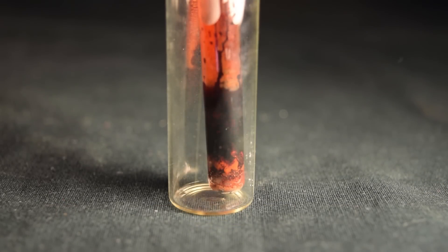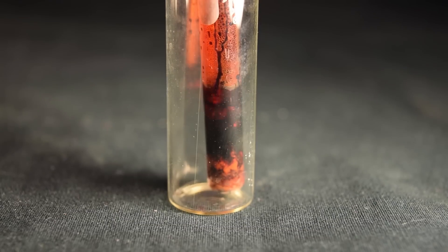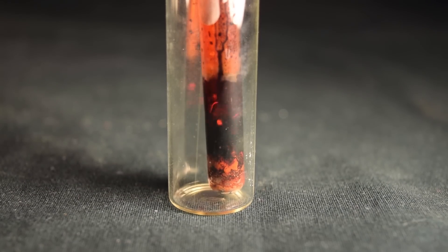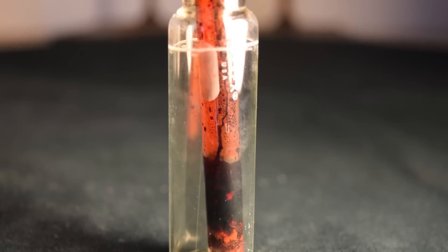It's been about four minutes now, and as you can see, most of the bromine has either been reacted with the mercury or it's boiled off, and a solid is starting to form in the bottom.